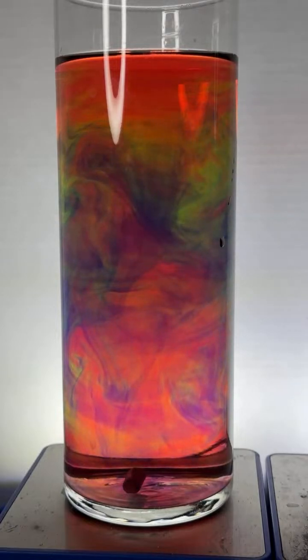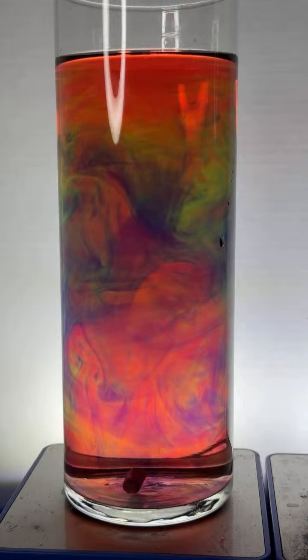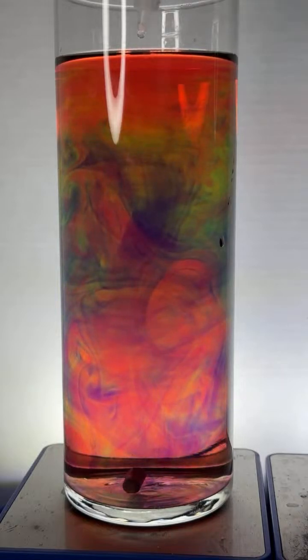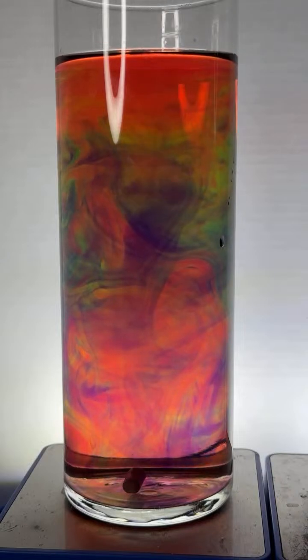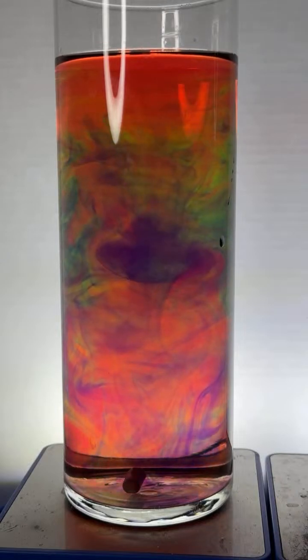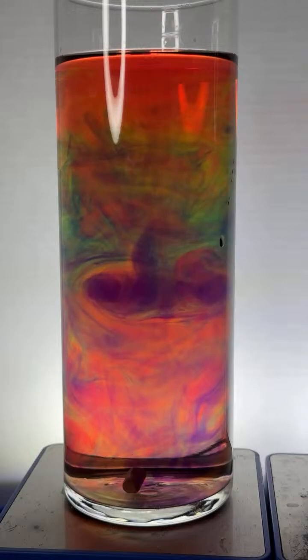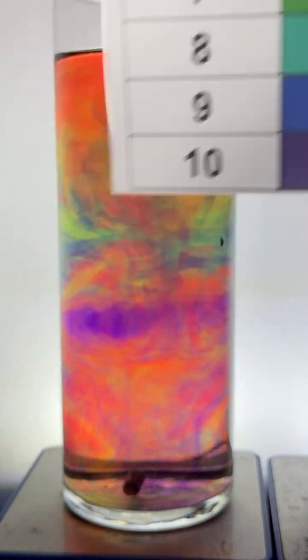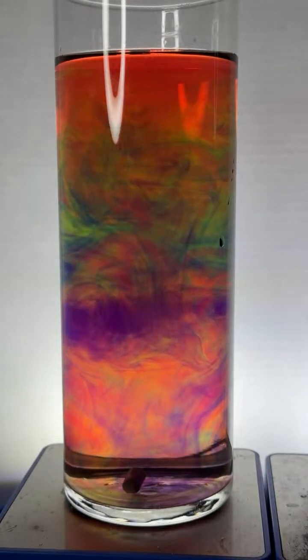And what's nice, you can sort of see the greens and the yellows kind of mixing in. And that makes sense, of course, because when you have, I'm going to add another drop of base over here. I think we need a little bit more blue. One more drop of base in there just to get it going. And when you see the greens and the yellows, that makes sense because the red and the violet are neutralizing each other. So you're going to see more neutral colors.